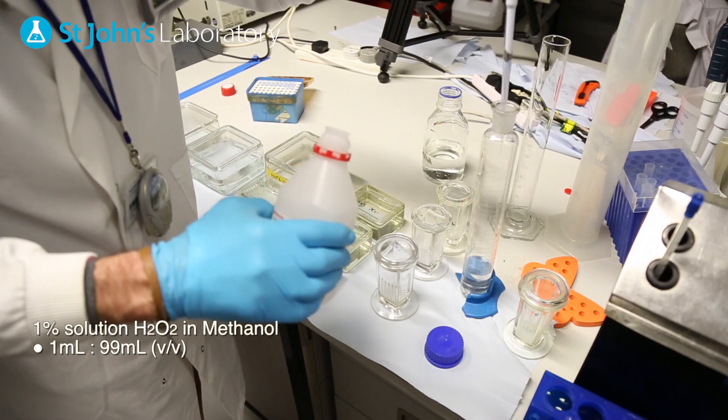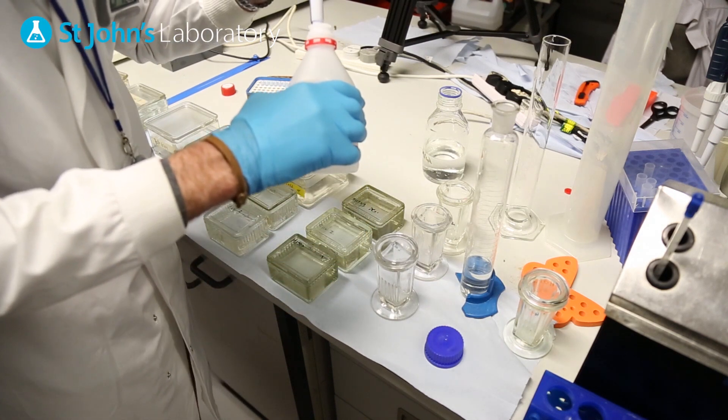While the tissue section de-waxes, prepare a 1% solution of hydrogen peroxide and methanol.